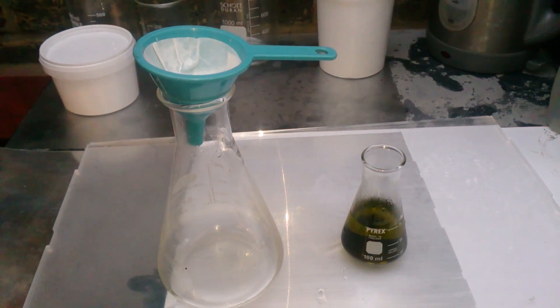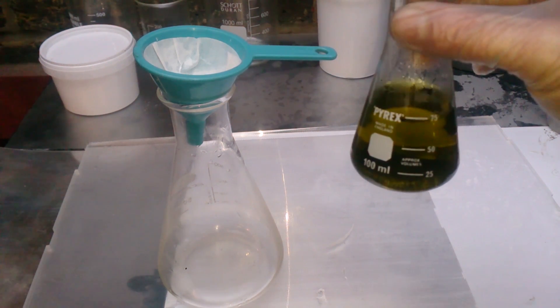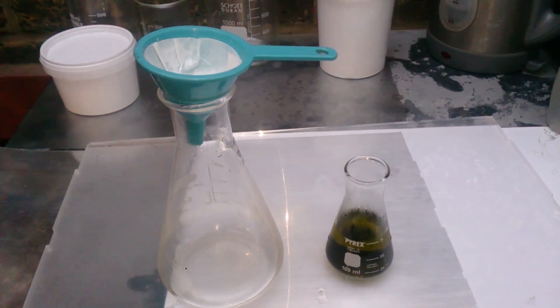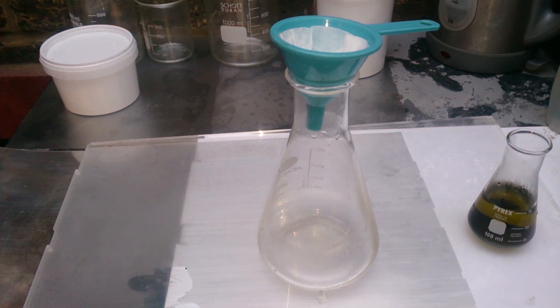This part was done three days later - not because I planned it that way, I just had other things to do. During this time, everything dissolved, leaving just some dark grey-black sediment. The aqua regia itself changed color from a tea color to kind of green. This tells me that the aqua regia successfully decomposed, because tea color is native aqua regia. As for the sediment, so far I'm not certain what it is - it could be some silver, because silver does not dissolve in aqua regia, or it could be some absolute crap, or even some carbon. Whenever you think it could be carbon, be careful because it may trap some gold. In any case, I just filter it out and don't discard it - I'll have a look later at what it could be.